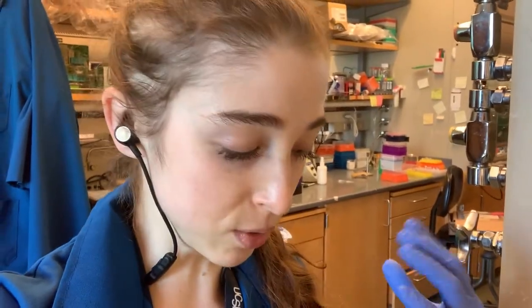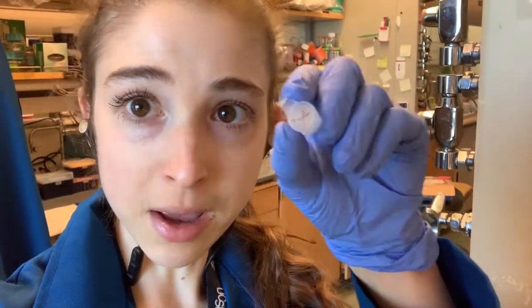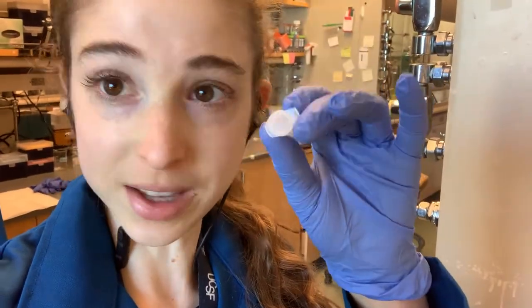Sometimes you'll see people have written on the outside how much is inside — like 440 microliters. If you're going really fast or need a really precise balance, that matters. If it's not as crucial, a perfect balance isn't always necessary. What's important is that you mark the tube as a balance — so put like an X or something on it — as well as labeling the tubes you actually put in there.